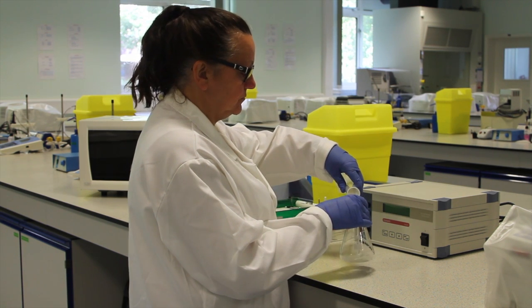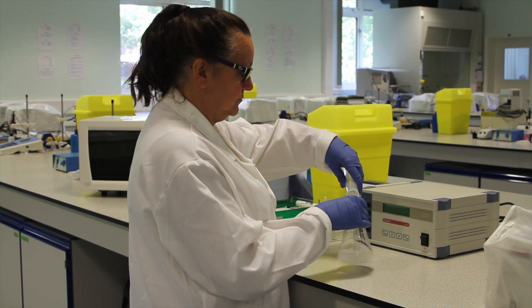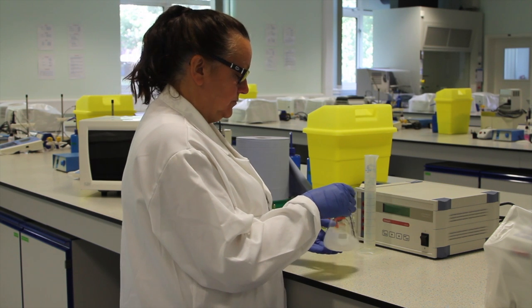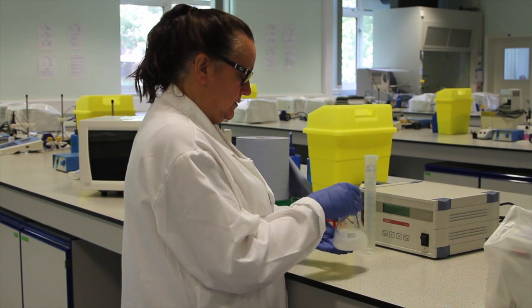Here we are preparing 100 milliliters of a 1% agarose gel. So 1 gram of agarose is dissolved in 100 milliliters of TAE buffer.